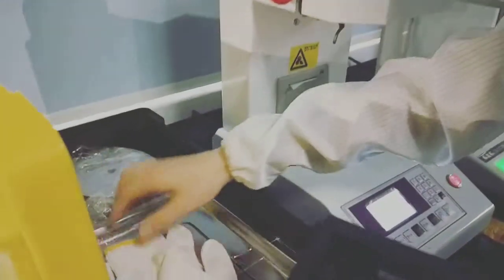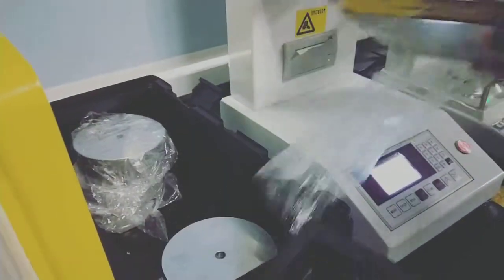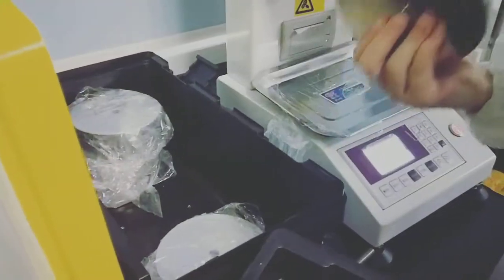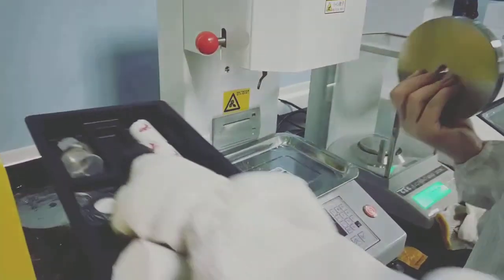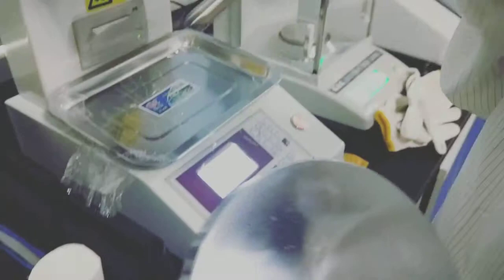And we can use this rod to make sure the die is to the bottom. And here is the sample plate. There are many pieces of weight. Here we need 2160. As this one already has 325, we add 1835.